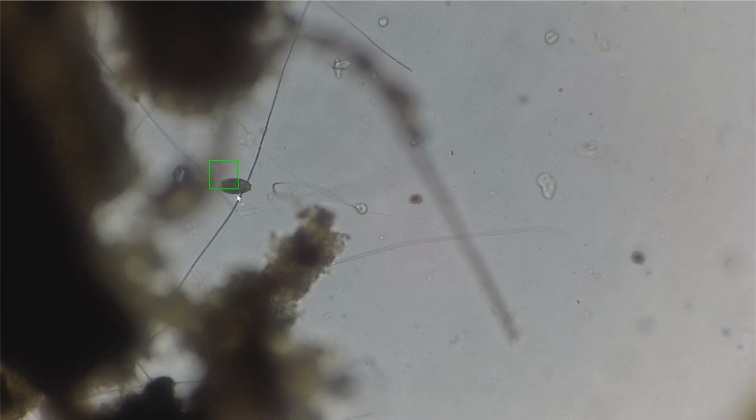So something interesting that has been added to this particular selection box is the ability of moving in the 4 cardinal directions to expand the view. And so that was a choice based on suggestions on how the program was a little hard to get on the corner sometimes. So this is a nice attribute. So I'm happy with this selection. If I'm unhappy with this selection, I can press escape, and then I can press S again, and then I can try to redo the mapping of the image.